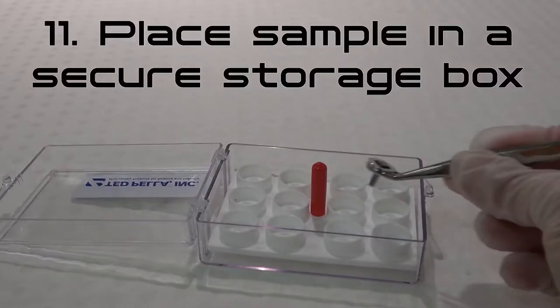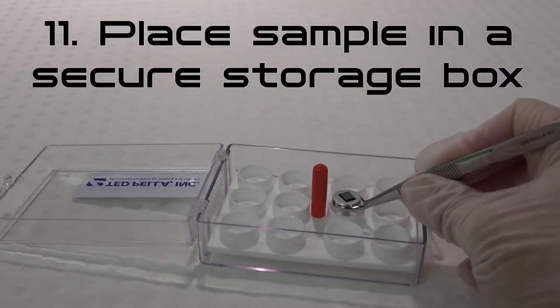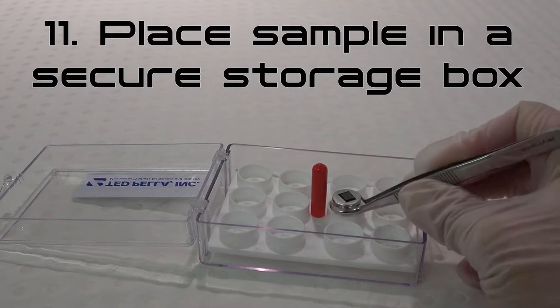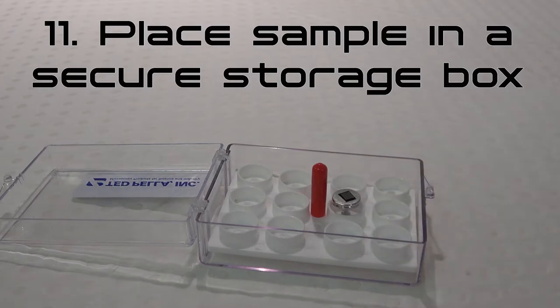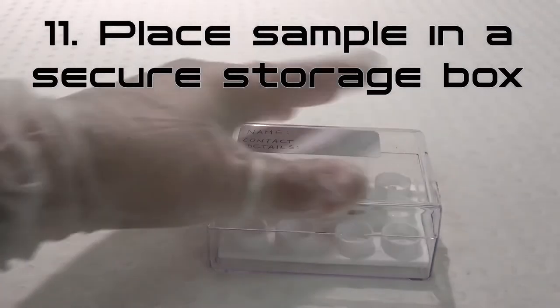Step 11: Place the mounted sample in a secure SEM storage box. Keep samples stored in a clean, dry environment.